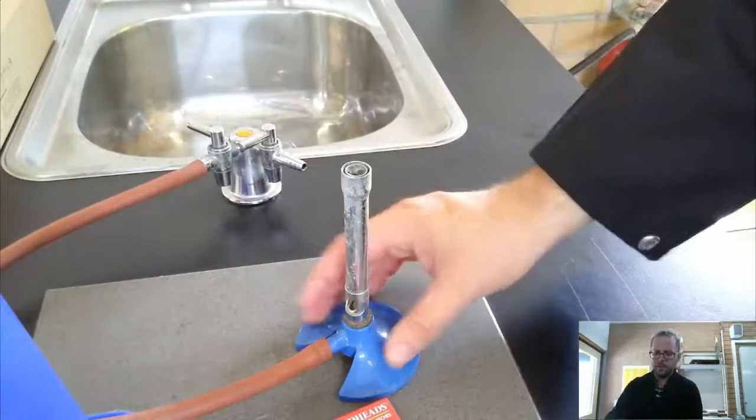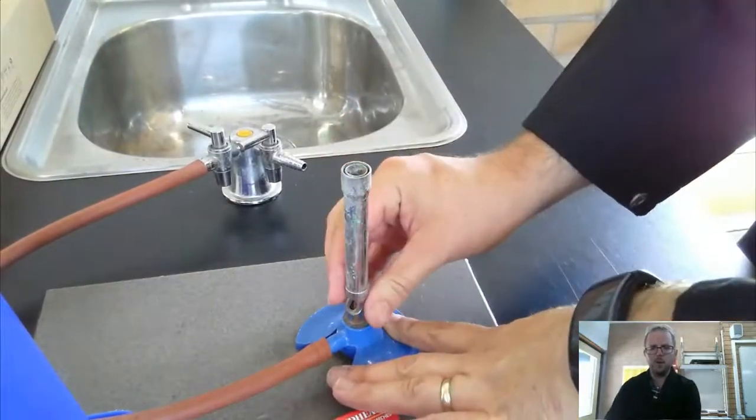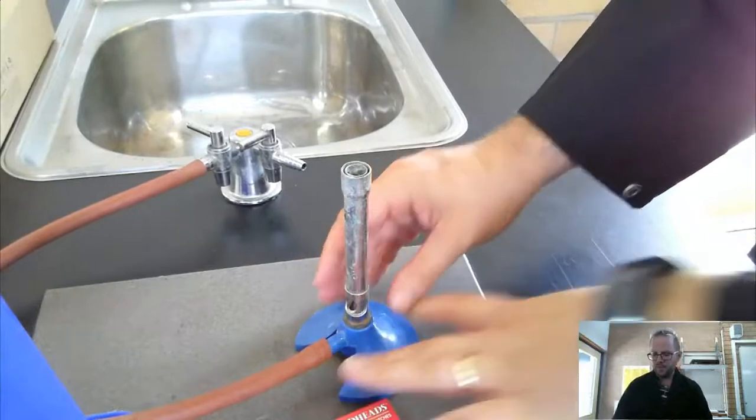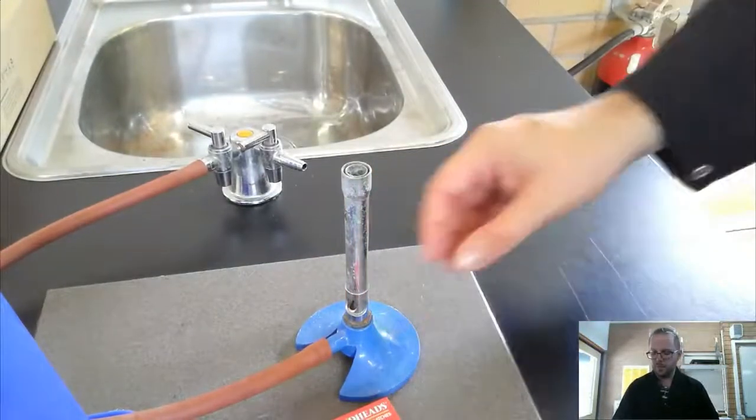Everything's connected up well, everything's all tight and connected properly, and the collar is free to move. It's just a simple thing we can do to help us to start with.